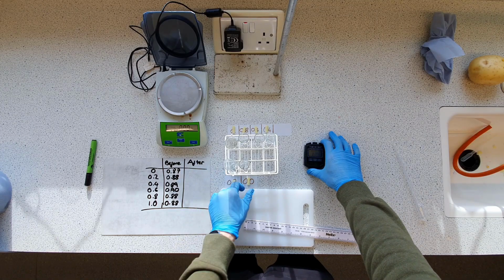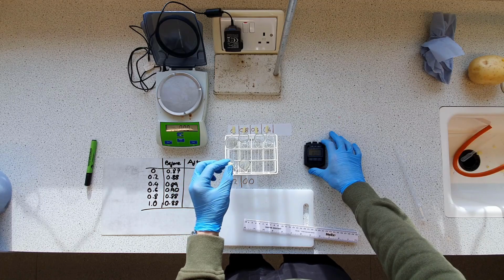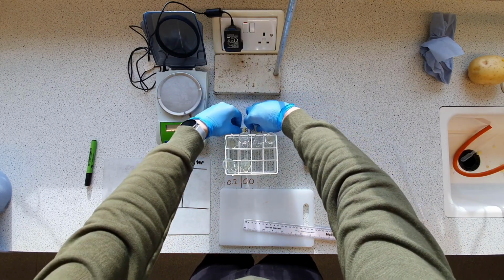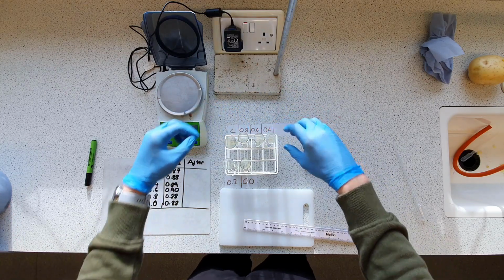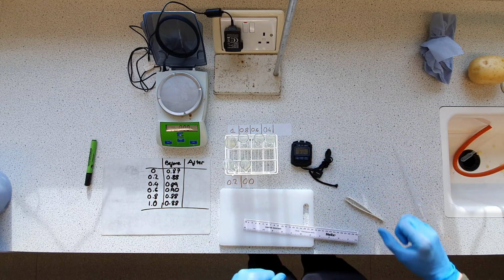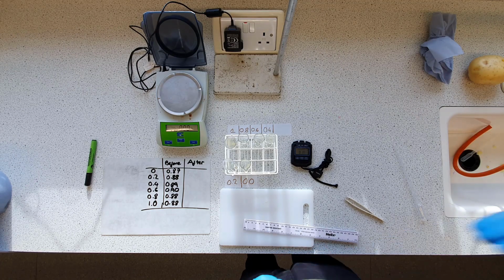So, start with that one, that one, that one, that one, and that one, and that one. Okay. I'm going to leave that running, and I'll be back quite shortly. Well, for you, actually quite shortly. For me, it's 20 minutes. And we'll see what our results are.